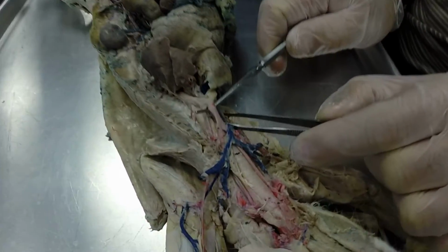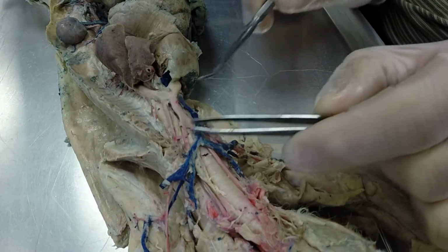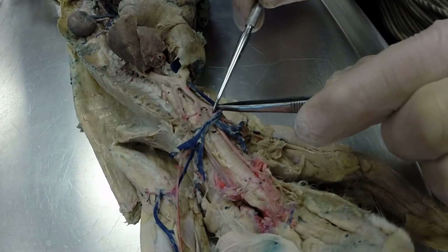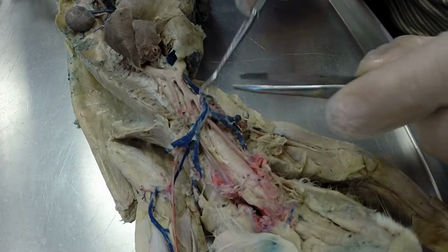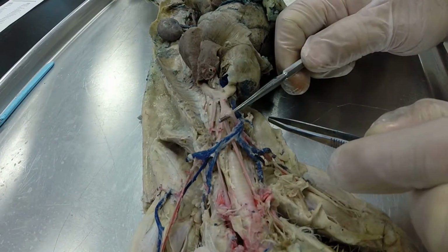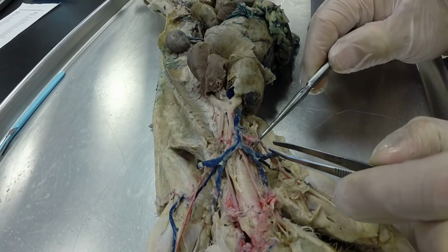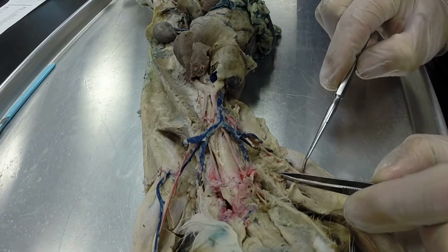The first vessel, this is your brachiocephalic artery. And this one has 3 branches. The first branch is your left common carotid artery, and that goes up along the left-hand side of the trachea. Next branch is the right common carotid artery. That goes up the right side of the trachea. Your third branch is the right subclavian artery, and that's going to continue out and become the right axillary, the axillary armpit region, and then it's going to continue across the arm and become the right brachial artery.